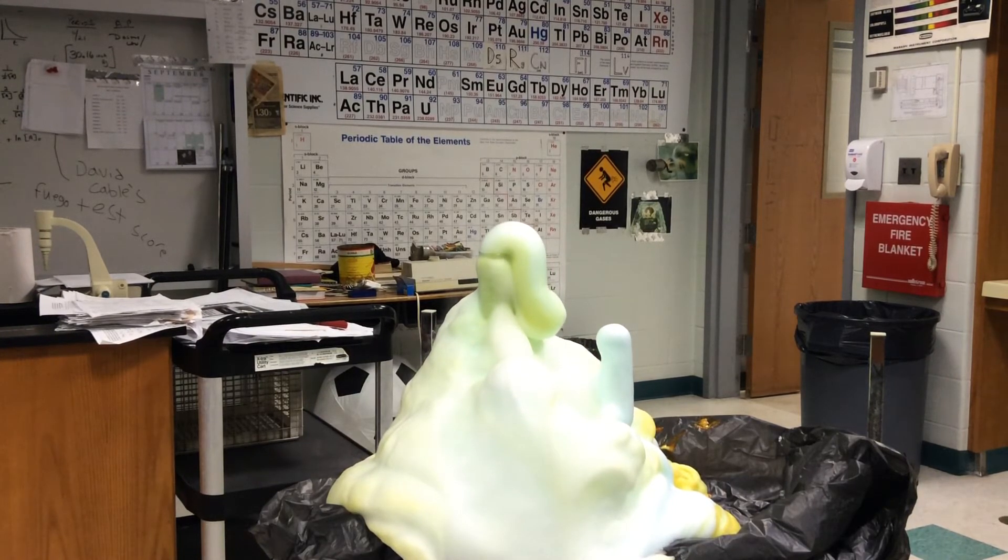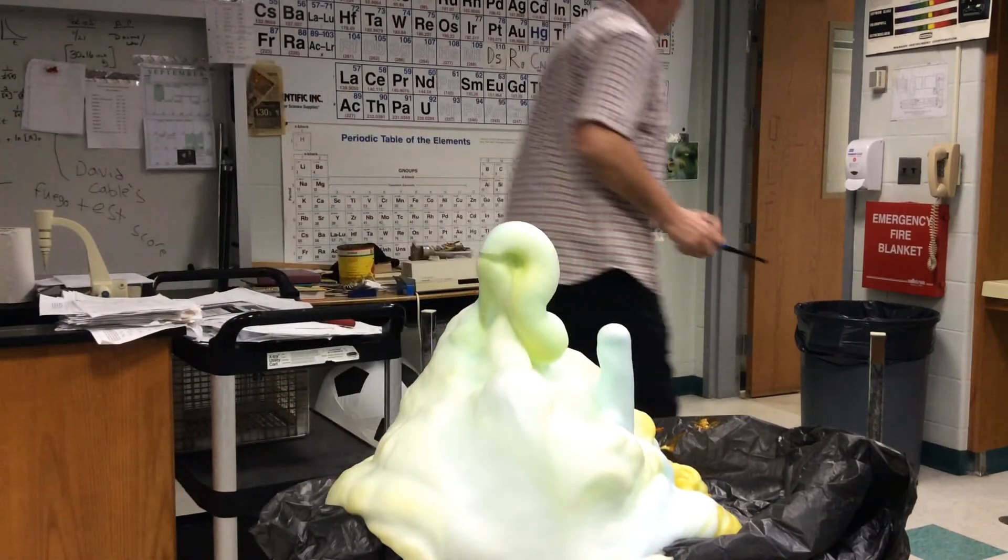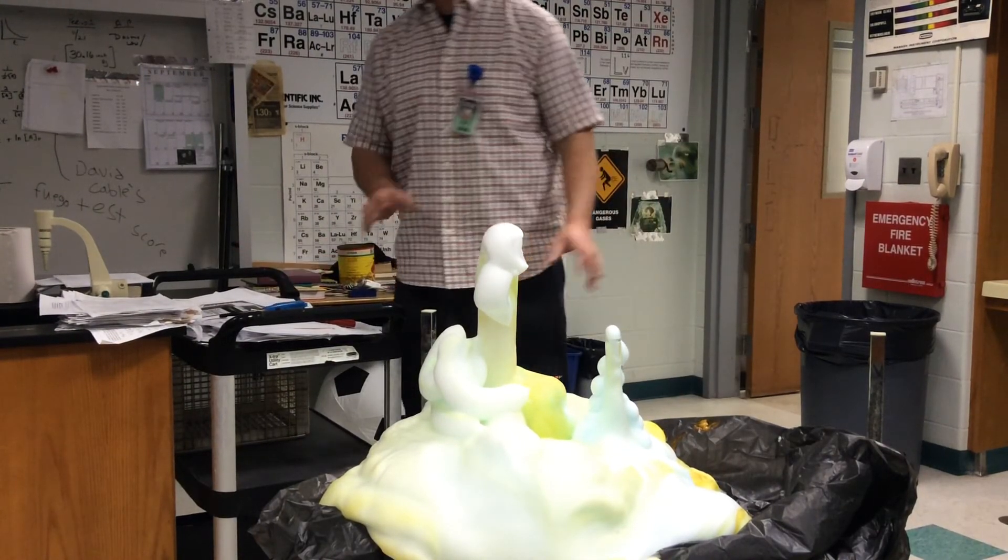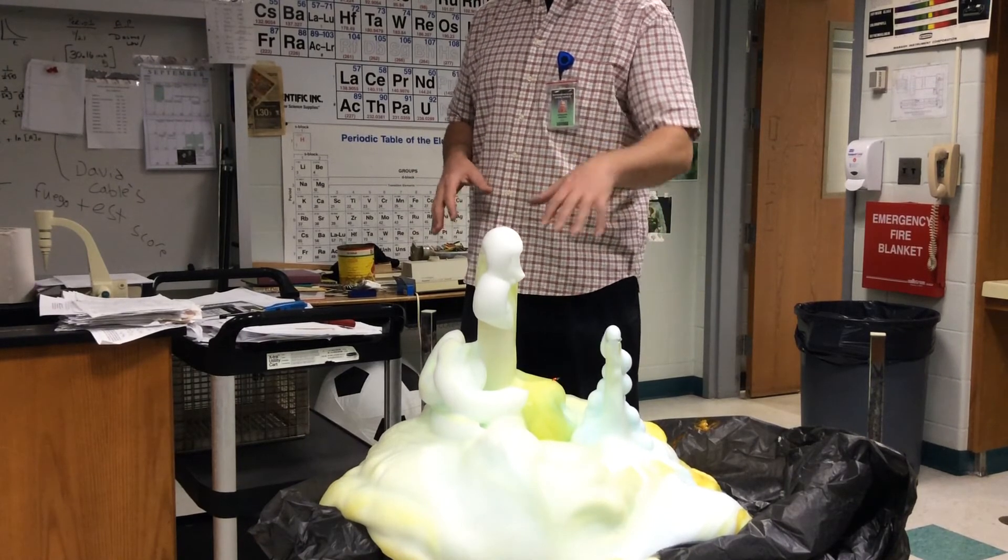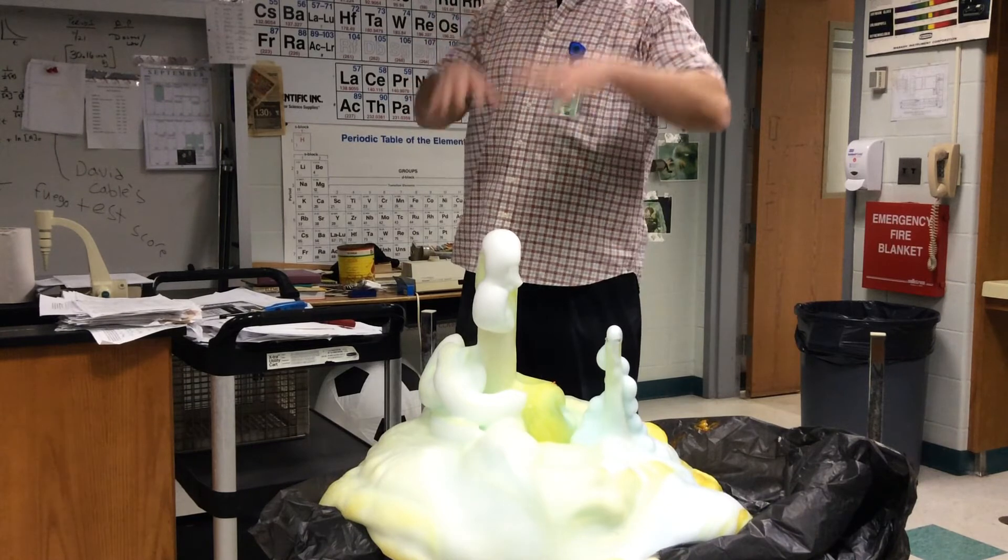Okay, so same idea though. Oh, that's a big glob right there. That's nuts. That was definitely worth it. Still going. Now you can see why it's called elephant toothpaste, right? Okay, so same idea. Here's my splint. Not doing much. You can see that the rate of reaction increases because there's more oxygen stuck in the foam. Okay. Ready? Oh. We'll just let that stay there. All right. You're going to do it again? No, that's it. It's a big enough mess. Please don't step on the foam. This stuff actually has iodine in it, but that was pretty small. I like that. It didn't go up high, but it definitely did a nice boom. All right.